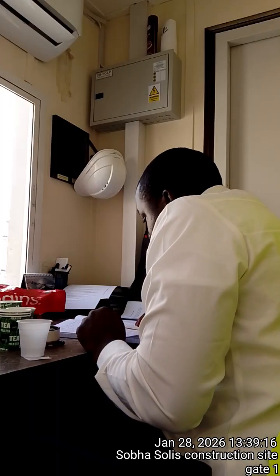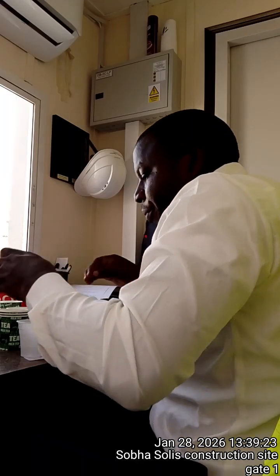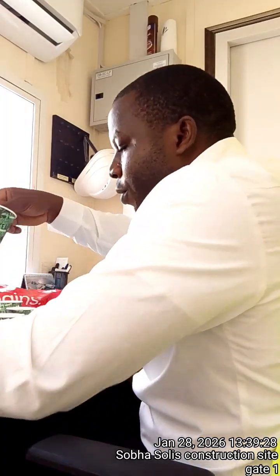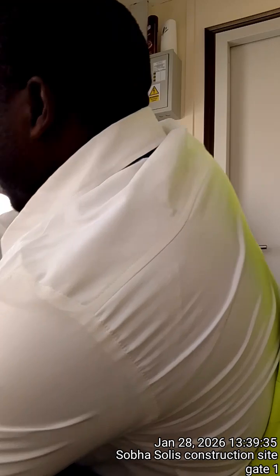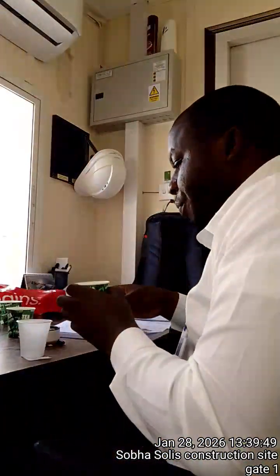Don't forget. So in this case, the second step is to add a small amount of baking soda to the sample. So I'm going to have two cups with hot water at the same temperatures and at the same levels. So I have hot water here, hope you are able to see this, and hot water here.